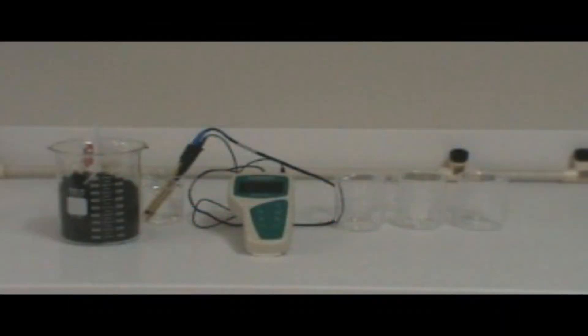Today we will be showing you how to take a pH measurement of a soil sample. For this you will require a pH meter, double junction pH electrode, ATC probe, three beakers, and a scoop or a spoon.